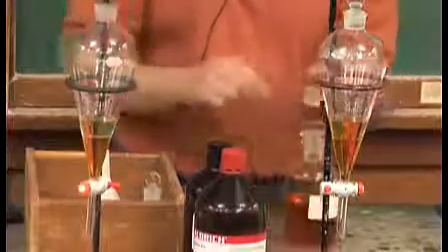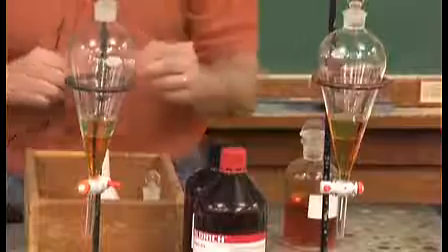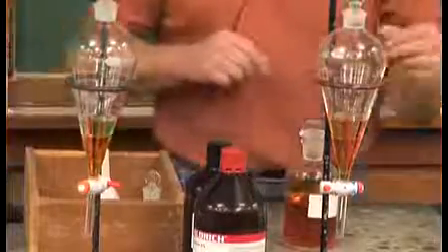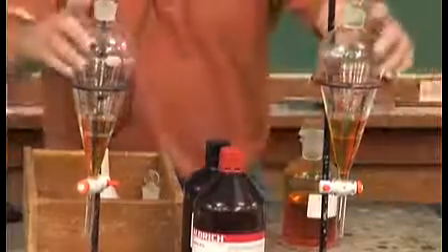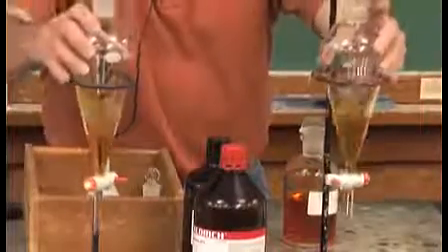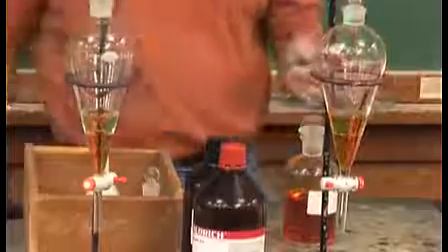Hey, you can probably take a look at this and see that the brominated water is pretty heavy stuff. Bromine is very heavy and it's sinking to the bottom of these separatory funnels. And check this out. I could shake a little bit if I really wanted to, but you can see one is reacting and one's non-reacting.